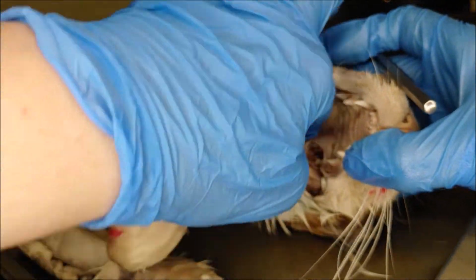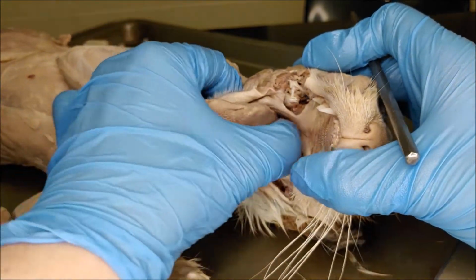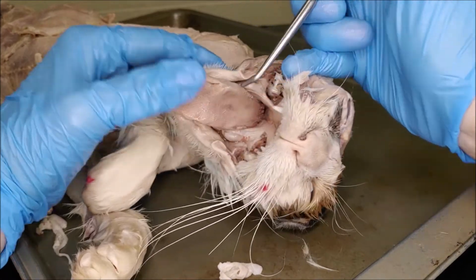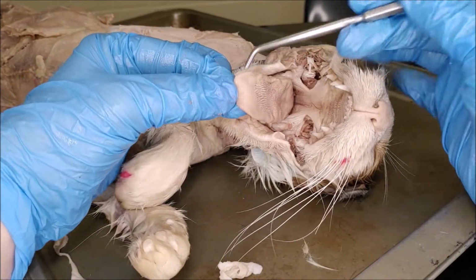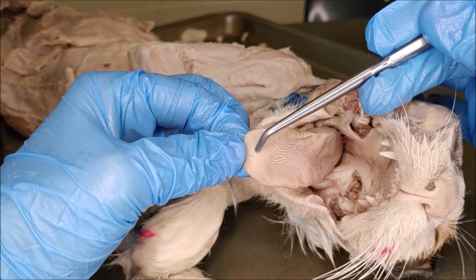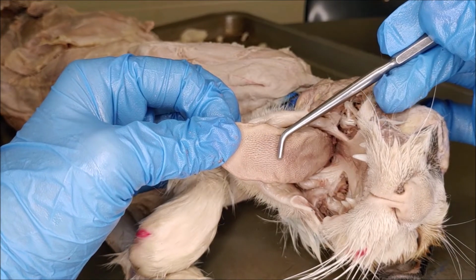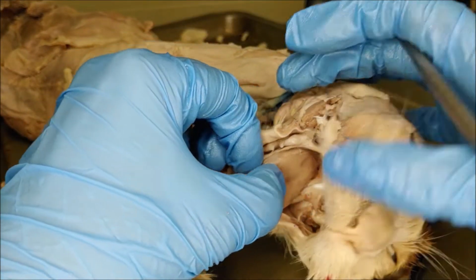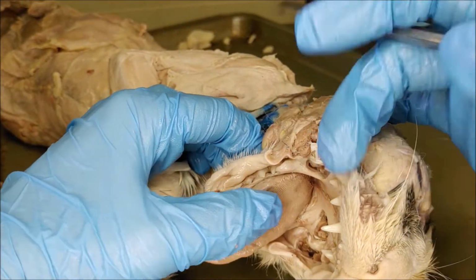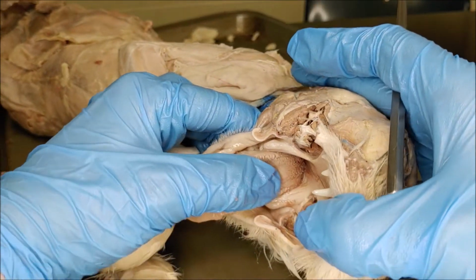And then we have the lingual papillae. Lingual just means tongue, and these are taste buds or modified taste buds. Not all of them are actually used for tasting, but up here in front are the fungiform papillae, and they are smoother. And then the filiform papillae, these are the rough ones that the cats use to clean themselves. On the sides and closer to the back are the foliate papillae. These look kind of leafy. That's why it's called foliate, like foliage.